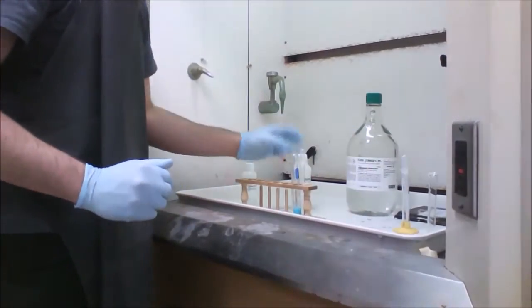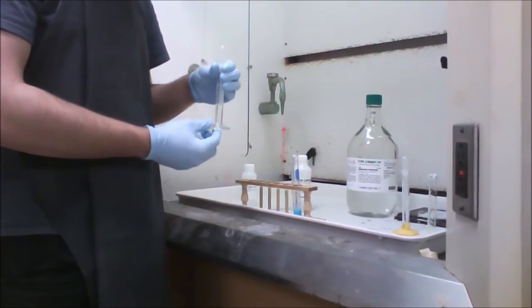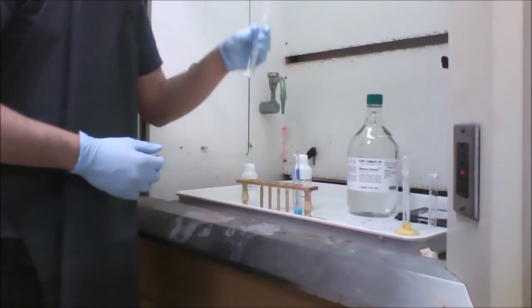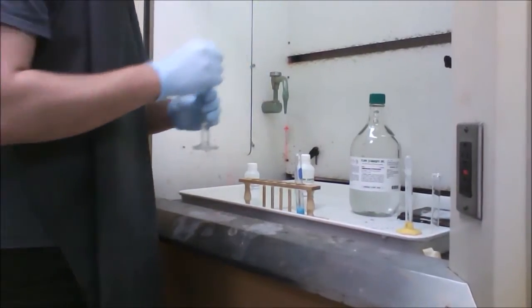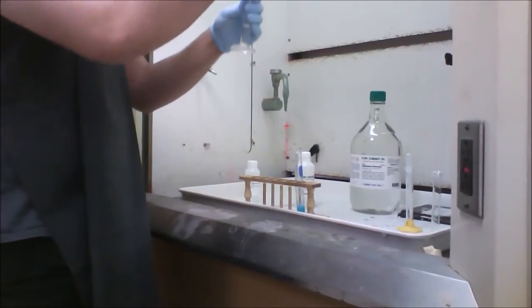Keep the test tube right there. Now we have 1 molar HCl. Remember to dilute it down in case you have some other concentration. So here we have about 5 milliliters, but we may not have to use all of it. So with the test tube, add 1 milliliter into the test tube of the complex ion formation.